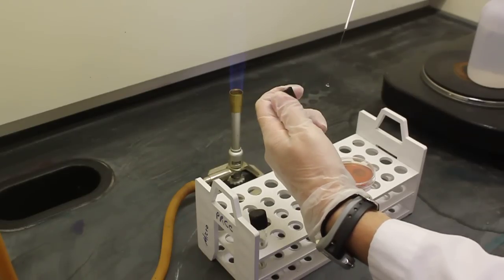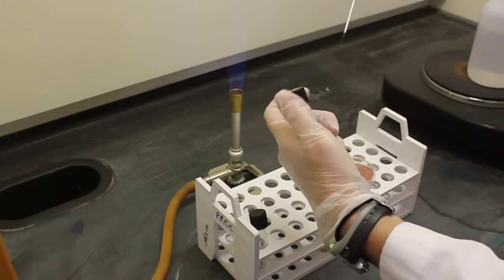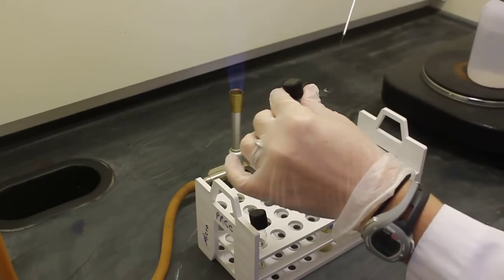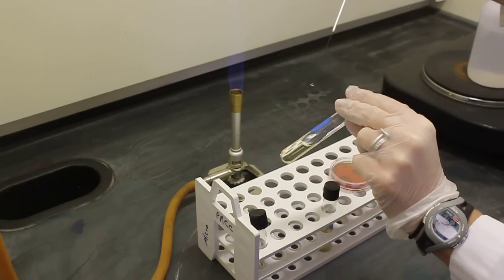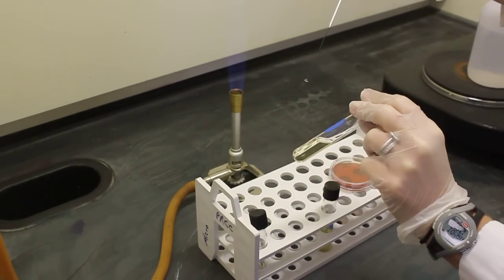Lid goes back on. I have inoculated my broth. You cannot see the bacteria in the broth, but it is there.